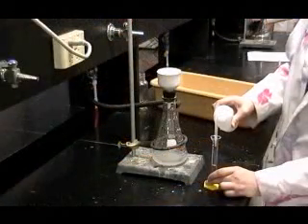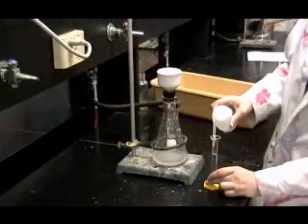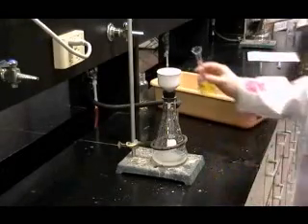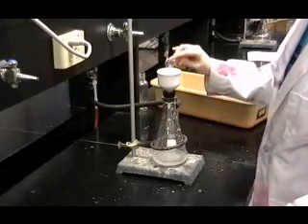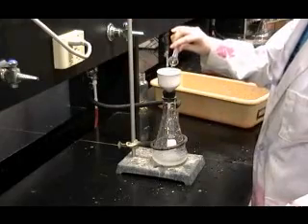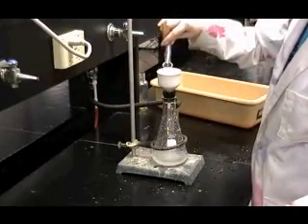In step 10, you will measure out 10 milliliters of ice cold water from your wash bottle and pour it slowly over the entire surface of the solid on the filter paper to wash out impurities. After 2 or 3 minutes, repeat the washing with a second 10 milliliter volume of ice cold water.